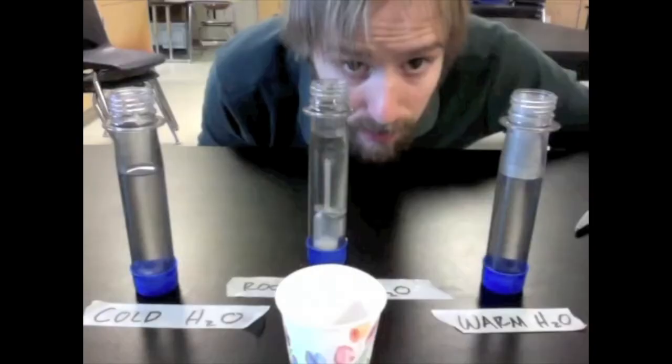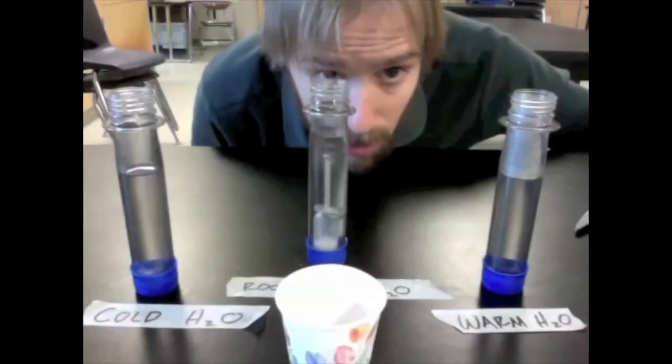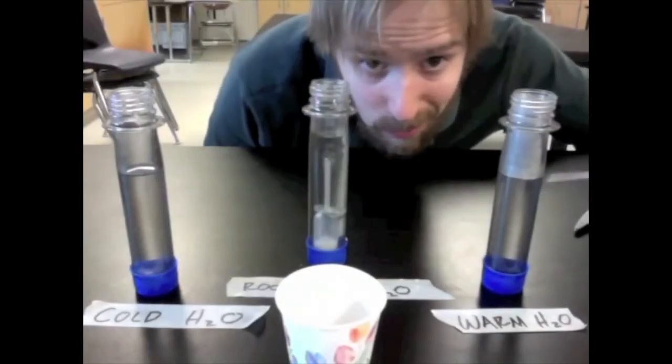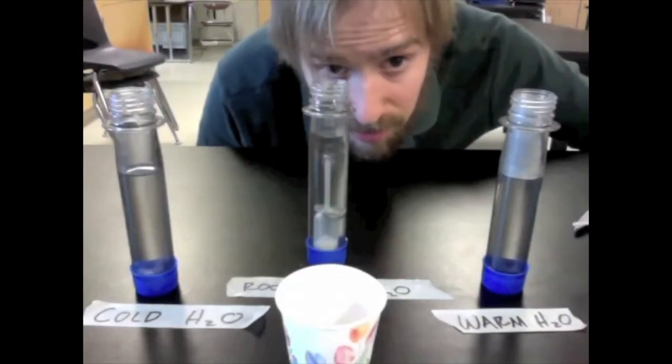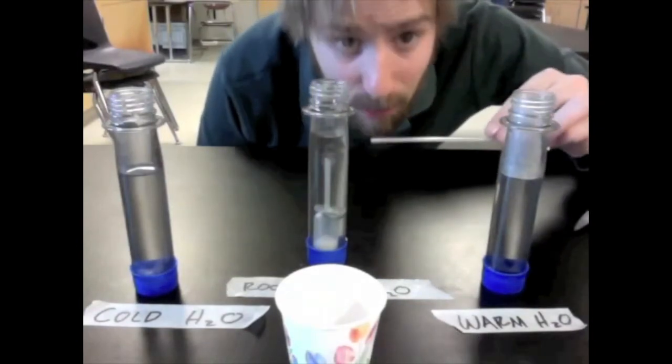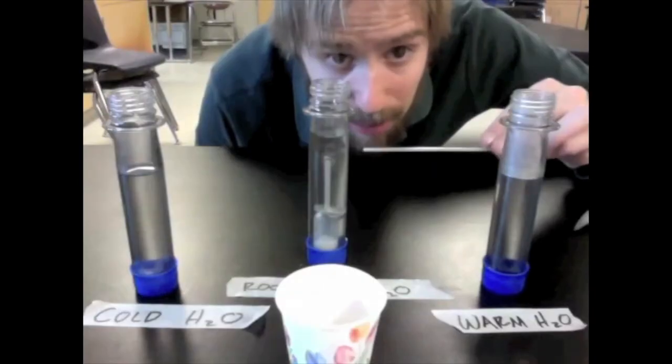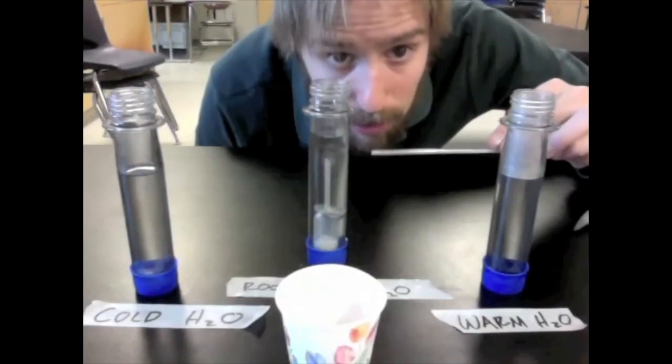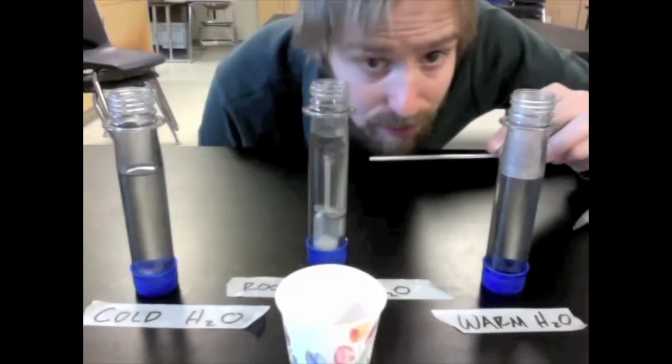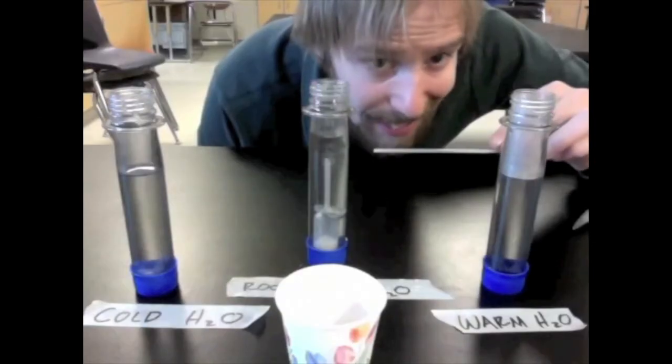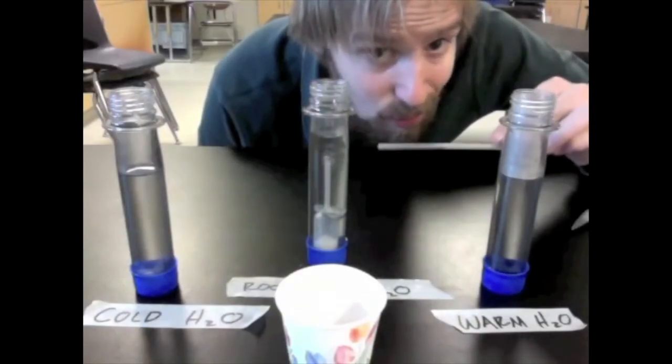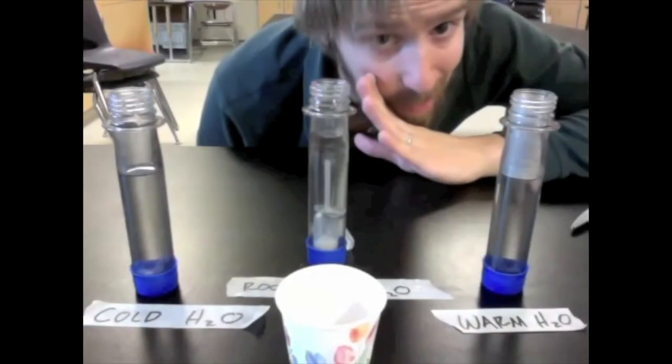Now once we've got all three of them set up, we'll do a little quantitative analysis to see what's going on here and see if there's any difference based on the temperature of these environments. You can already see, we see some evidence that fermentation is happening here by the release of bubbles. And if you remember what happens during fermentation, you should be able to predict the gas that we would find inside of those bubbles. It's carbon dioxide.